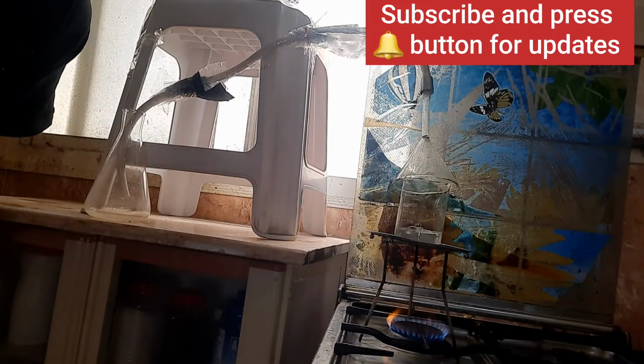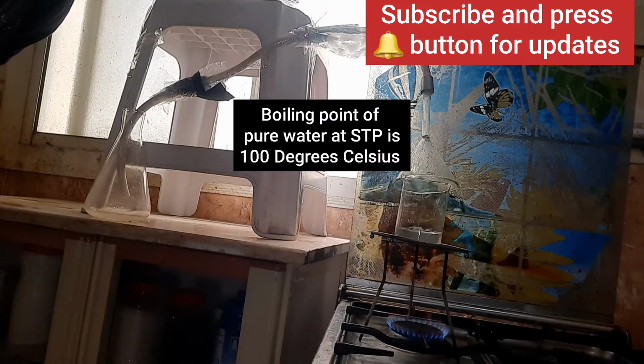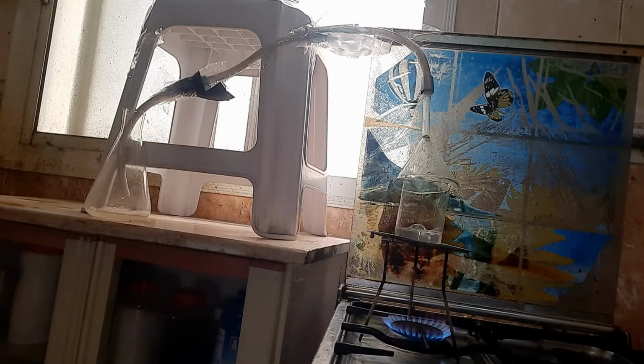All of you know very well that the boiling point of water is 100 degrees, but it is not pure water, it's a solution, so the boiling point is a little elevated. So I am going to increase the heat a little bit more, so the procedure is going to be fast and we will get water into that flask earlier.